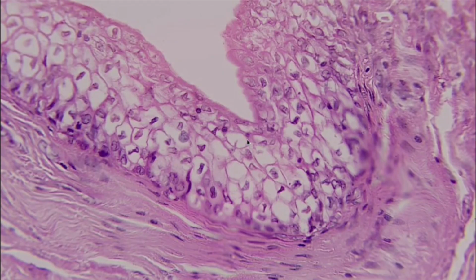Now this one is a bit of a tricky one. This is going to be our transitional epithelium. And the way we can tell that it's transitional is because of the fact that we are seeing a lot of variation in these cells. Whereas a lot of them on the other ones we've looked at prior, they're very uniform. Transitional, lots of variety. And typically you can tell the cells change from one shape to another as they go from bottom to top.